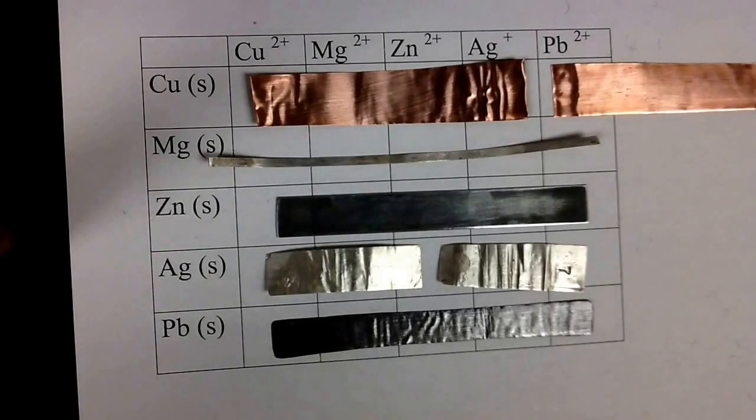Good morning, afternoon, or evening, everybody. It's Mr. Mock, and I'm going to go over our metal reactivity lab. So this is how scientists will determine how reactive metal is compared to others on our periodic table.